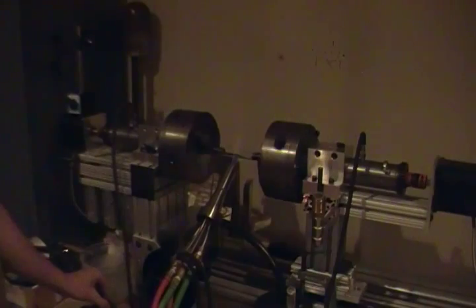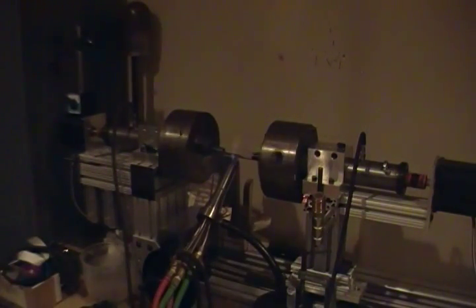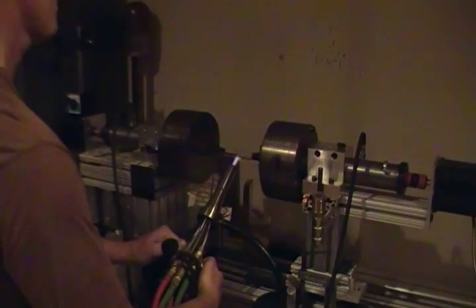But as a good practice to get good results, I like to have the parts hot and warm anyway, just because you get a little bit better results. So you have very little time outside of the flame in which the material remains liquidous so that you can actually work it. So use really high speeds on the lathe, and you gotta put a lot of heat into it. So here we go. I'm going to let this soak and kind of warm up a little bit here.